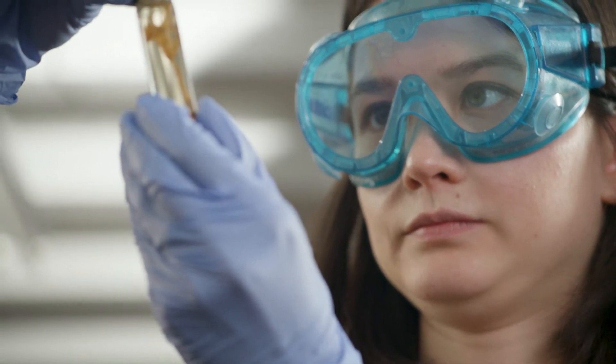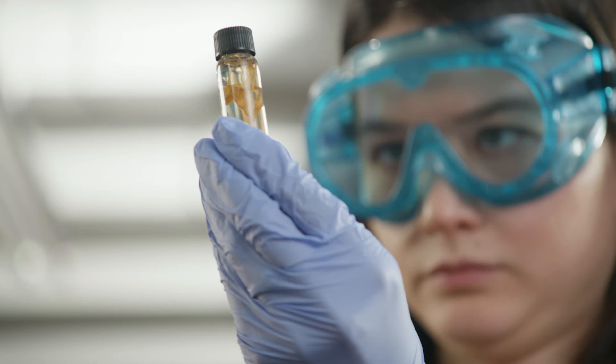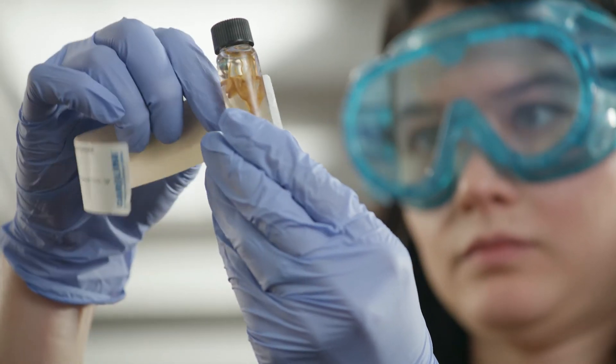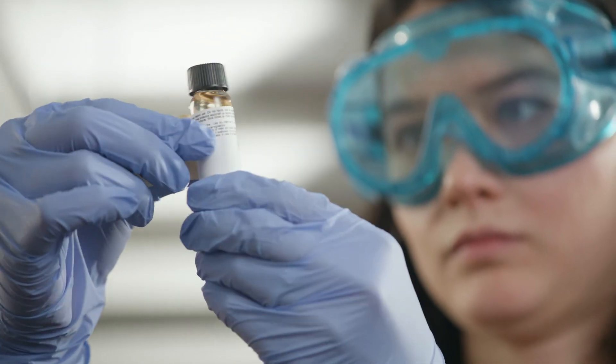Identifying a structure at this stage will make it easier to identify later, even if the flower or structure becomes damaged during the investigation. Be sure to replace the label before removing the label from another container.